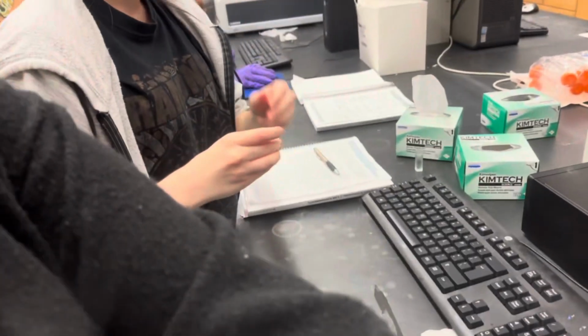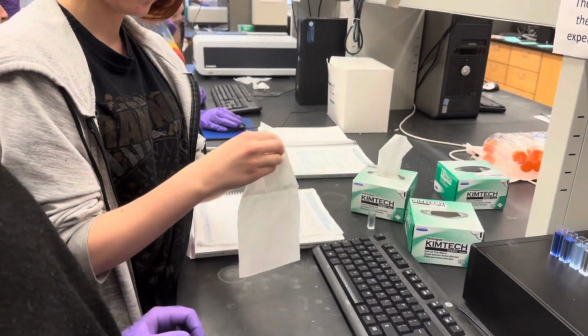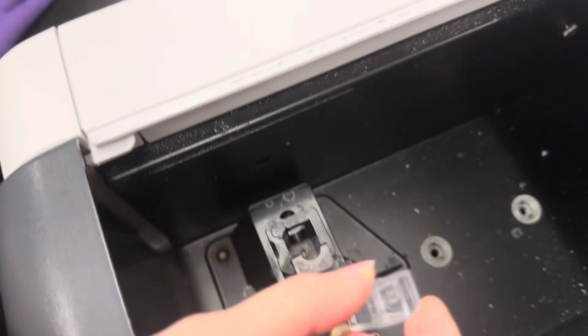And then if you look, you can see that all of these are filled up right to the line, counting in for the meniscus. Okay, ready to clean off the cuvette before we put it in? Okay. Alrighty. There, put it in.